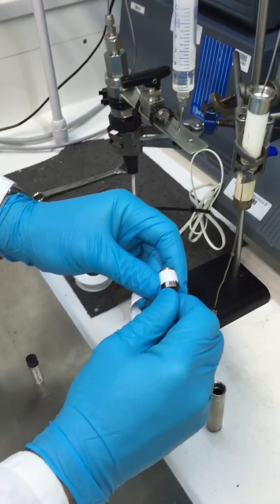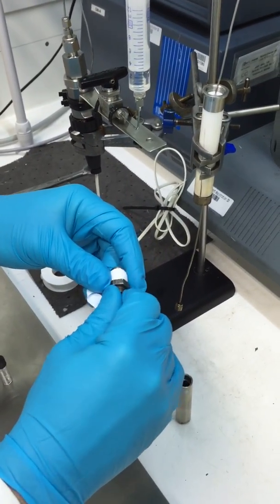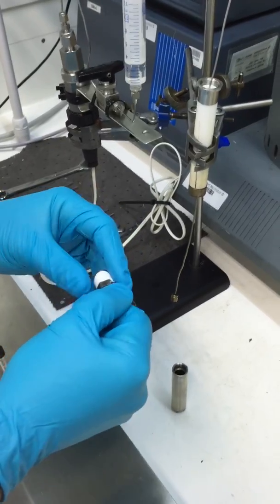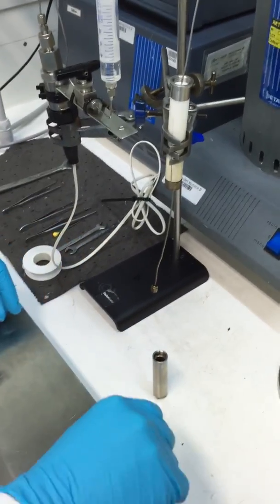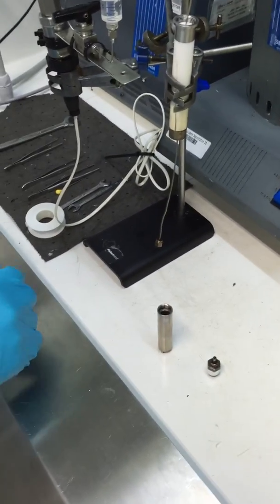You can also look at the pressure trace that indicates whether your sample has leaked during the test. If it has leaked and hasn't held pressure, you will then have to rerun that test.